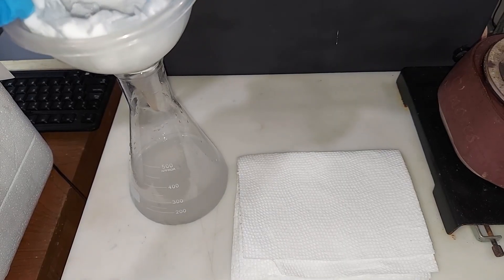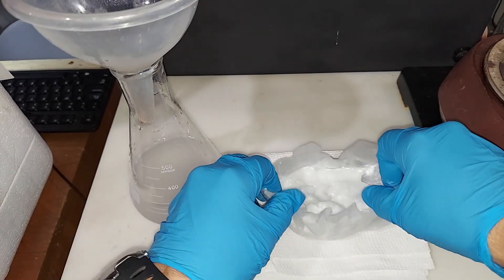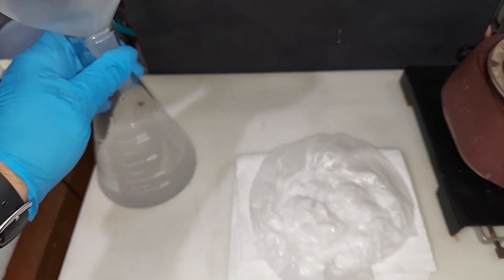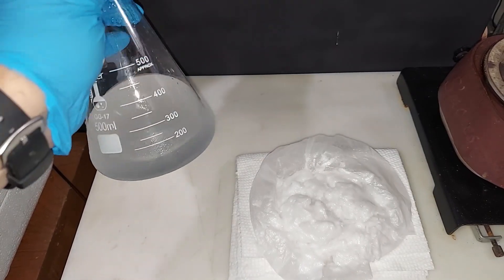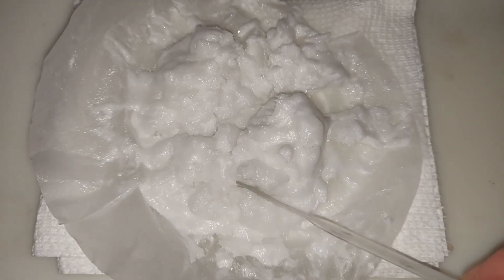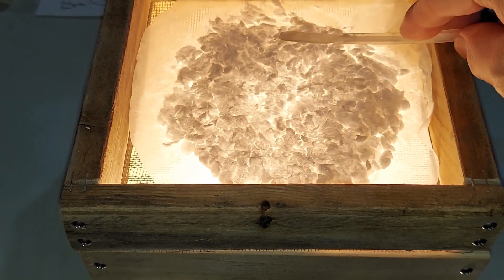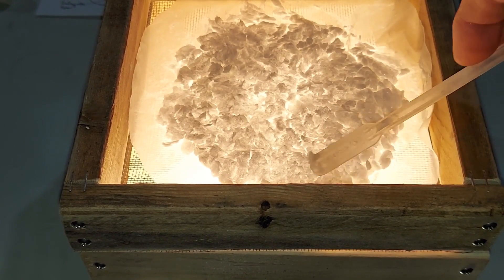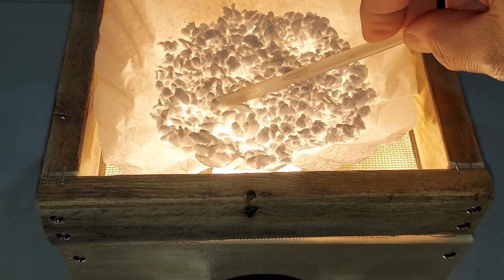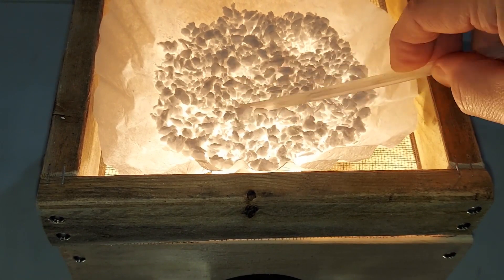It's done filtering, so I'm removing the filter paper and laying this out on paper toweling until some of that water is absorbed. I'll change the toweling a couple of times. You can see that even with double filter paper some still got through — it's not perfectly clear but much better than using one sheet. Just chopping it up to have more surface area for drying. I've flattened the salicylic acid into a very thin coating on top of the filter paper and it's on top of the light bulb heater to dry quickly.